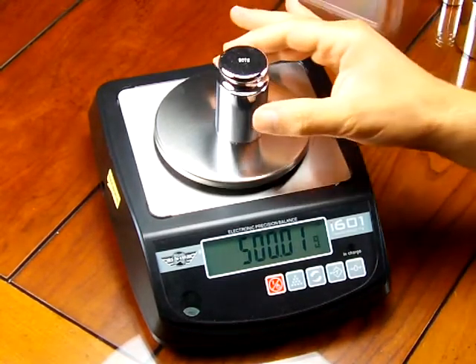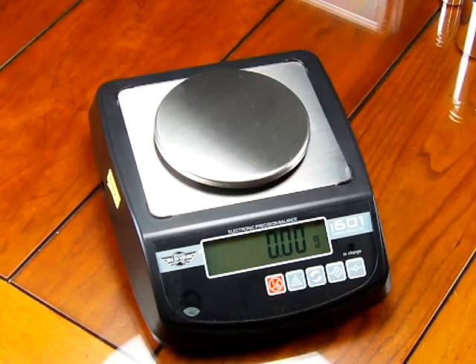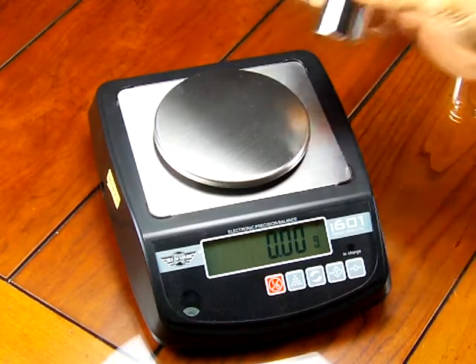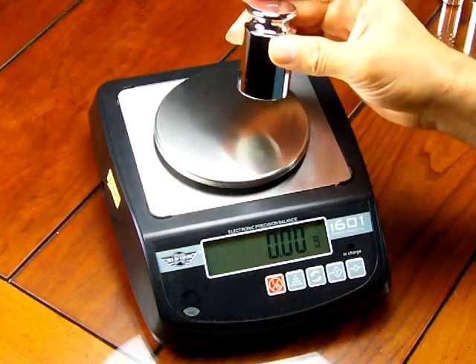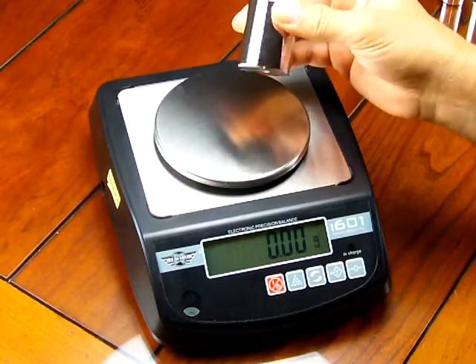it does require a 500 gram calibration weight. We do have these. This particular calibration weight is an ASTM class 6. It's just a steel weight that's chrome plated.